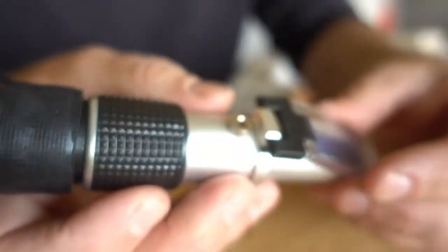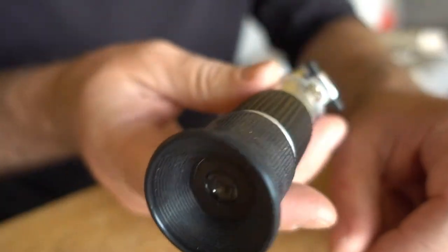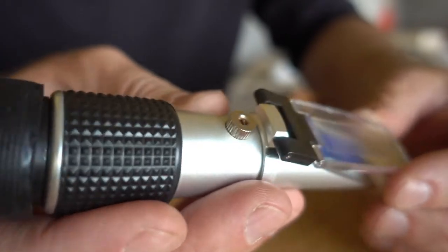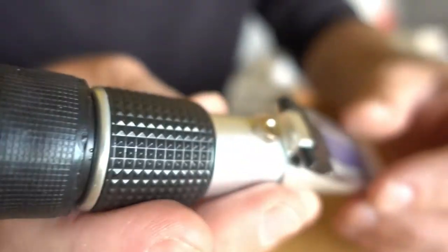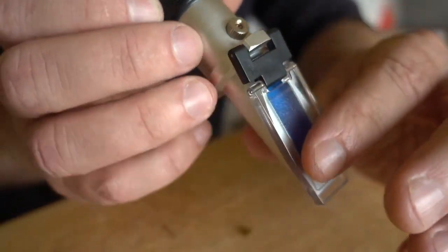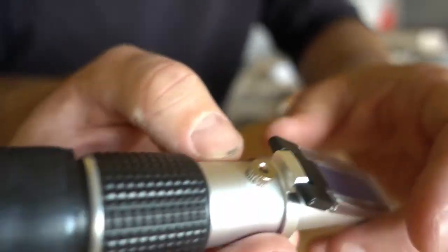You can still get a refractometer because it's the quickest, well yeah, it's the safest way of determining whether it actually is honey and if you're selling honey to the public then it's a good thing to do.